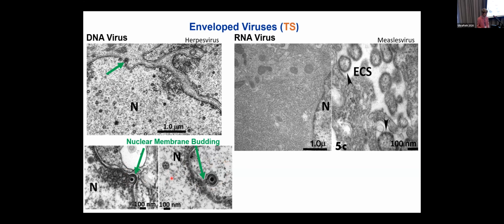Now, herpes virus is sneaky. It can leak through the nuclear pores and get into the cytoplasm as a nucleocapsid unenveloped. But then it will bud into vesicles in the cytoplasm, or it may bud through the cytoplasmic membrane into the extracellular space. On the right-hand side, we have an example of an RNA virus.